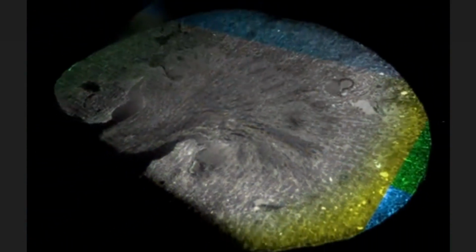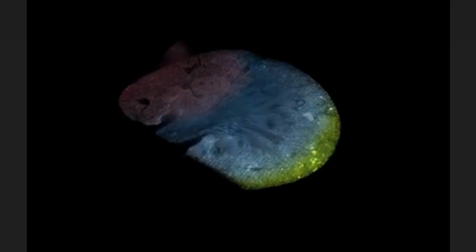So this is happening interactively when you are using Imaris. You're not going to notice any of that resolution change. It is happening dynamically as you are playing with the software. If you imagine Google Earth, or if you're looking at Google Maps and you look at the world and then you zoom in on San Francisco and you can see all the streets and buildings and things like that, it's the same concept. We use the resolution size that is appropriate for the detail that you can see at that zoom level.